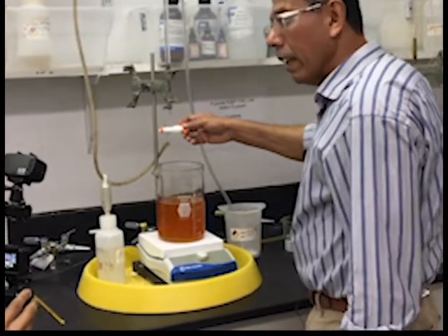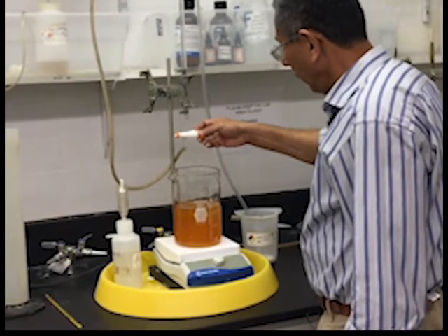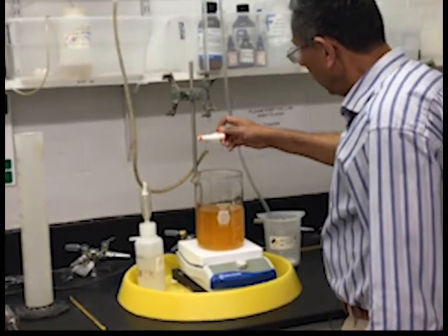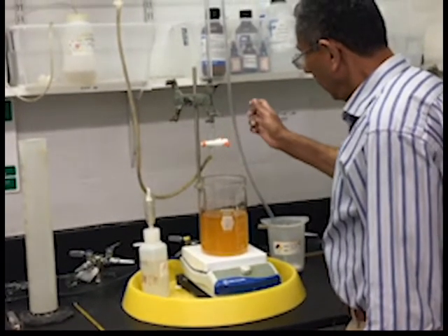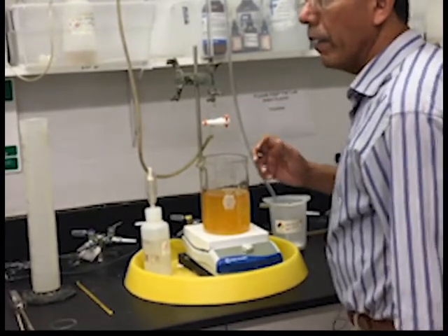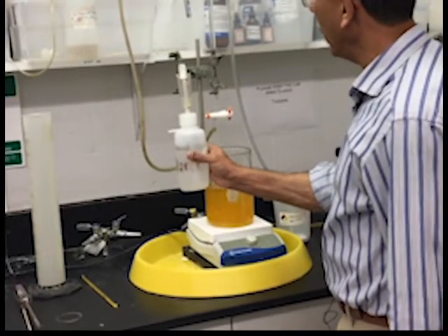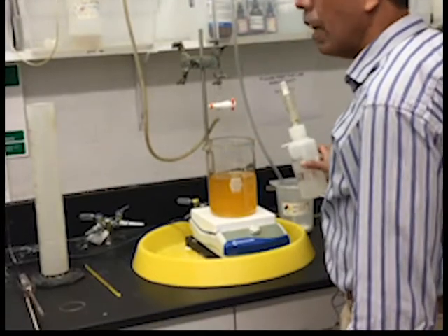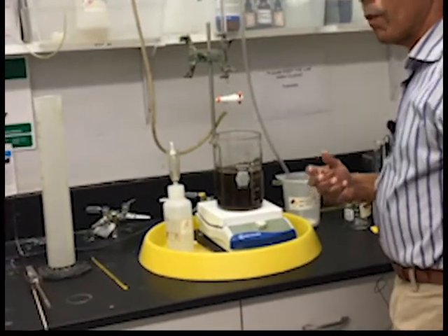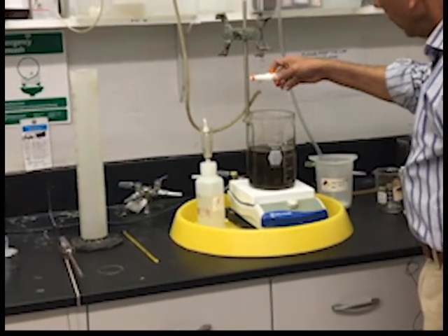You can see slowly the orange is going away and this is becoming more and more yellow. In theory I could let this go from yellow to white, but actually there is some iodine in there. To help do the titration easier — if you remember, starch and iodine together will turn dark blue — and this will make the color change more prominent. So now you can see this is dark blue because of the starch, so I am going to keep adding until this blue color disappears.